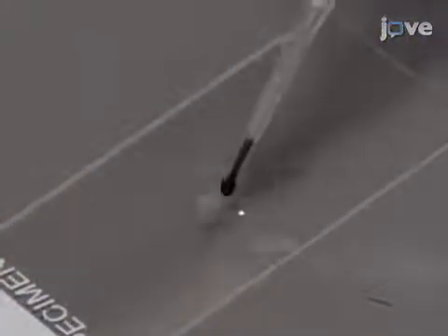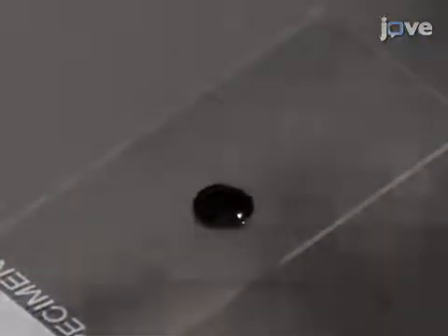Pipette 2 microliters of india ink stain onto the sample and mix it by physically pushing the pipette tip into the sample and moving in a circular motion until the india ink appears evenly distributed.